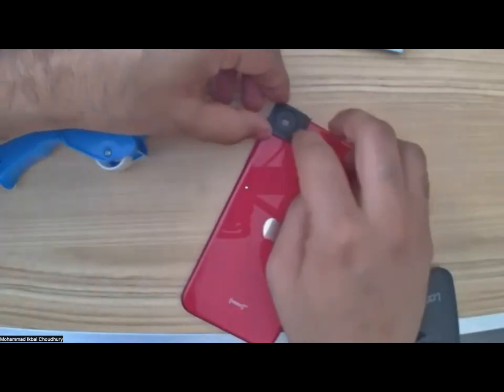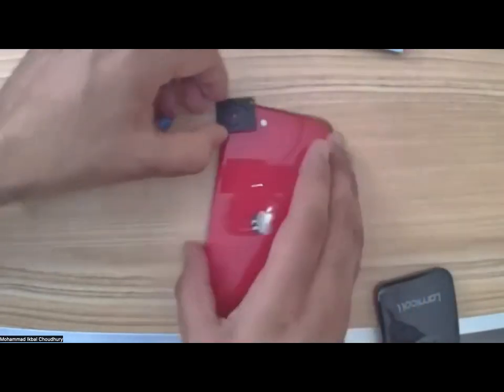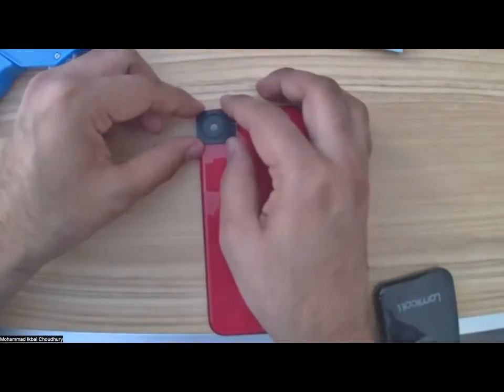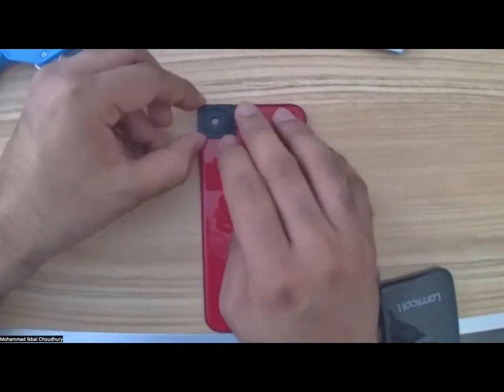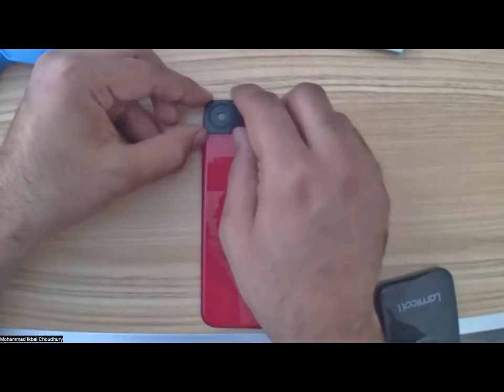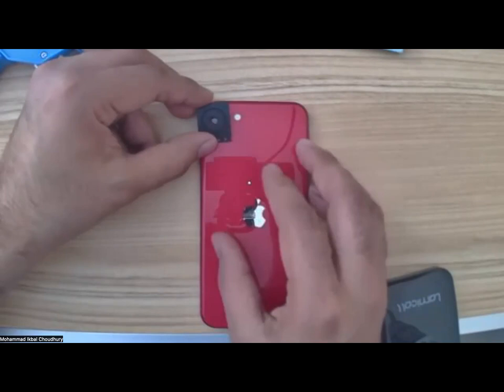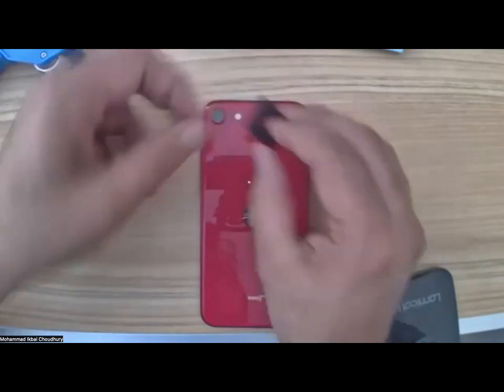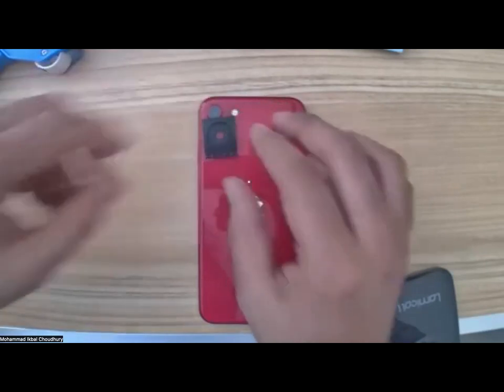And the idea is to connect it like that. So the groove side, or the non-silver side, will get connected to the microscope, right? Let me try to align it so that you all don't feel dizzy. Okay, so it needs to be like that. I'll try to point my camera precisely at the center of the hole that I can see in that magnetic strip. It can be like that, or like that as well, depending on where your camera is on your cell phone. If your camera is at the center, life is easy. You can place it like that and tape it up. But since my camera is on the corner, it's a little harder. But let's try to see if we can do it.